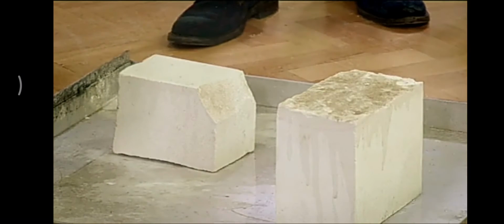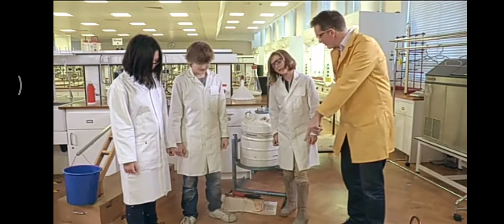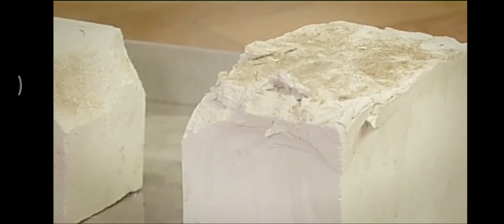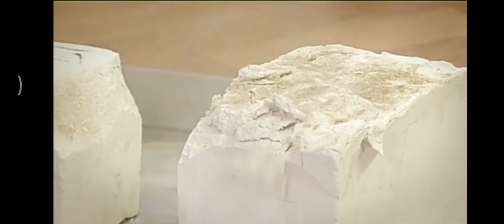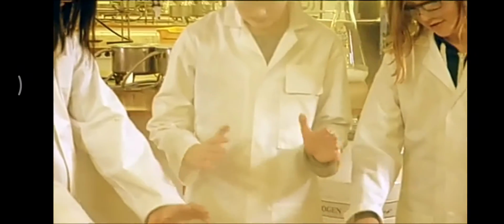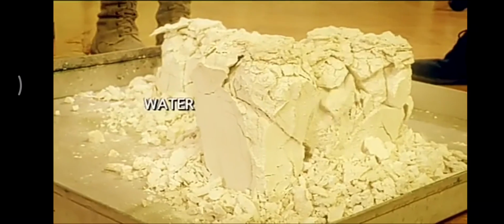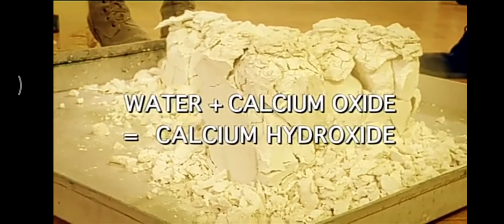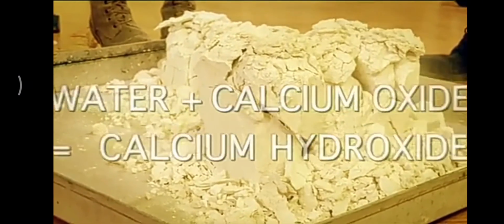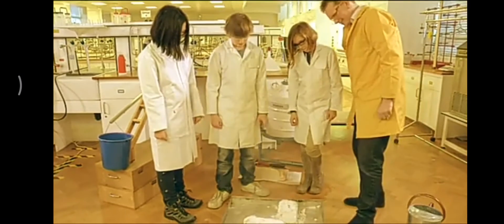And what have we got now? Carbon dioxide? No, it's not carbon dioxide. There's no carbon left in this. It was only calcium oxide. As the water reacts with the calcium oxide, it gives out heat in what's called an exothermic process. The heat turns some of the water to steam. And what's being made? It's a substance called calcium hydroxide, which when dissolved in water is called lime water. Lime water is used as a test for carbon dioxide.